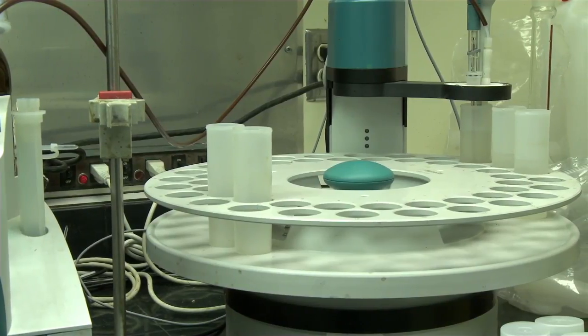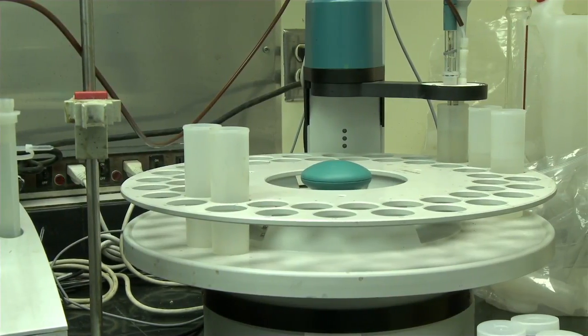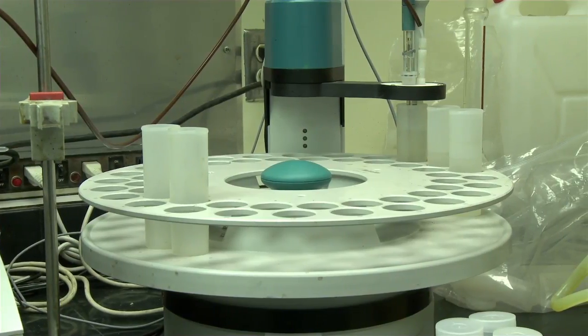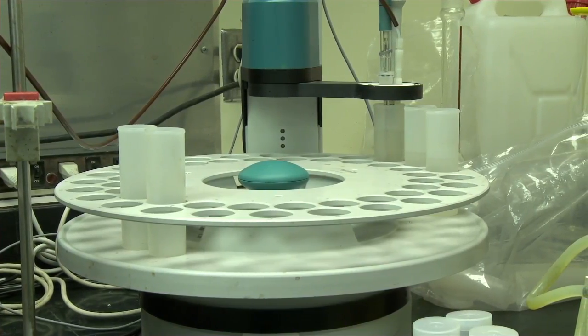We'll get maybe 60 samples in, and I'll prep them first and then put them on a carousel, and what comes out is the alkalinity concentration. For those produced waters, it mainly runs from 2,000 to 4,000 parts per million in some of the wells.